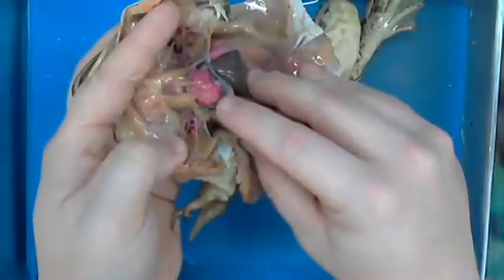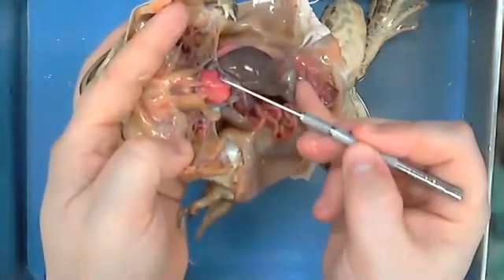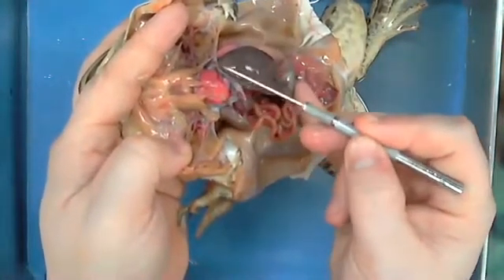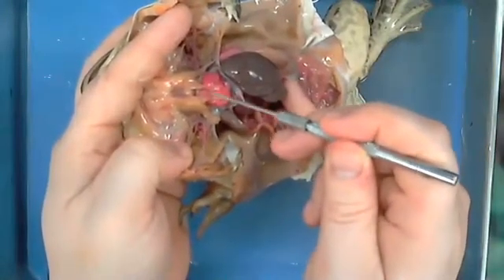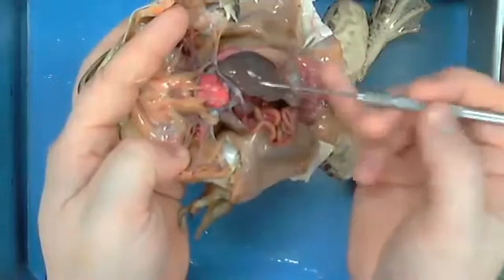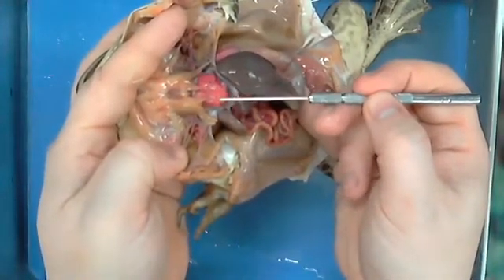There we go. This very tip is going to be a ventricle right about here. And then up here and up here are two atria, a left and a right, and then he has his actual ventricle. By the way, what is this covered in?